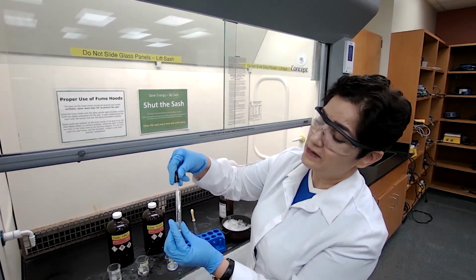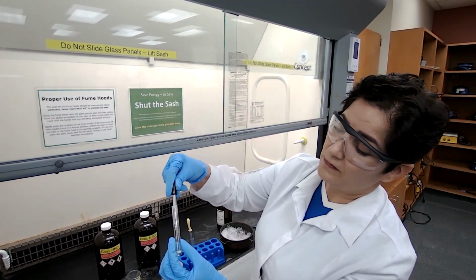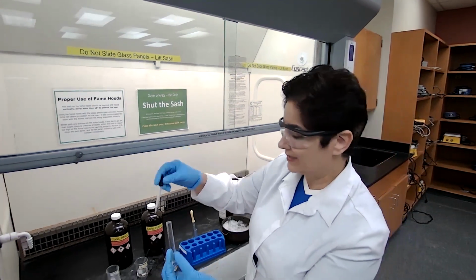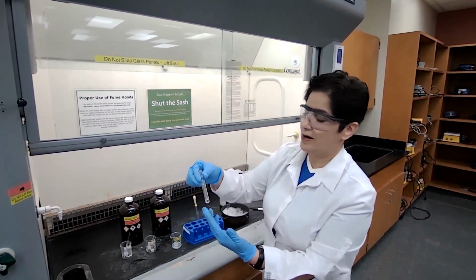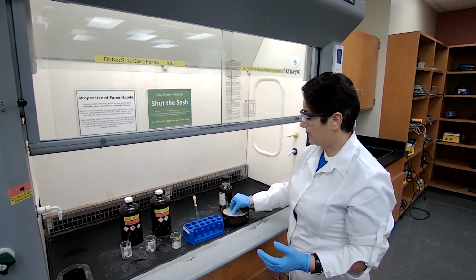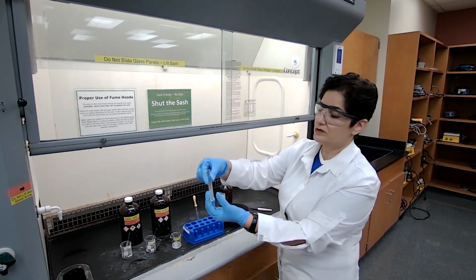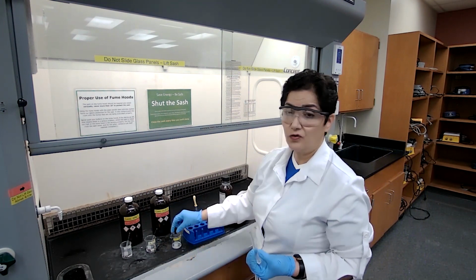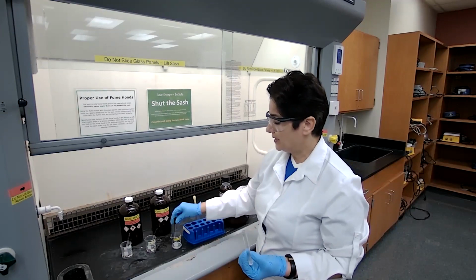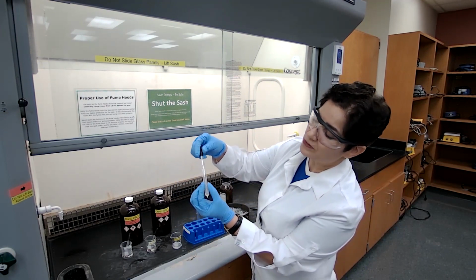So the nitric acid, 1, 2, 3, up to 10. You can just trust me that I did count the 10 drops of each and place them in test tube B. I'm also placing test tube B in the ice. Now, to the first test tube that contains the sulfuric acid, I'm adding 0.4 milliliters, which is going to be 8 drops of the methyl benzoate.